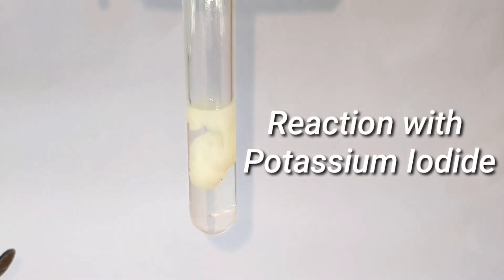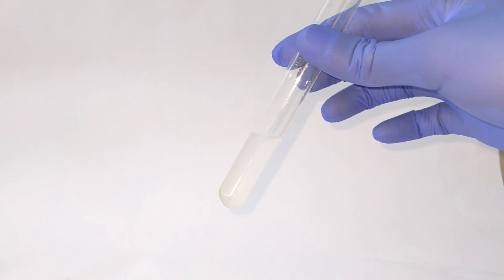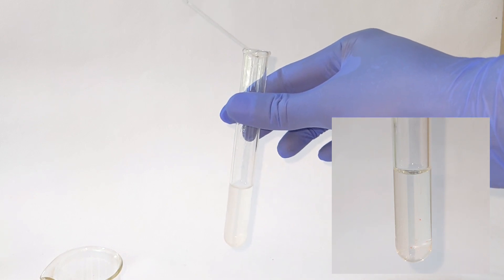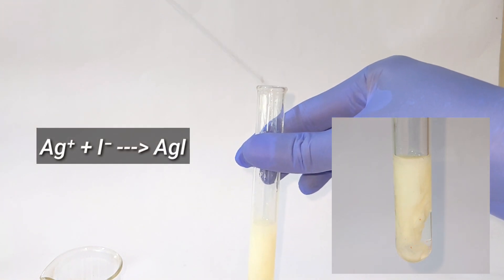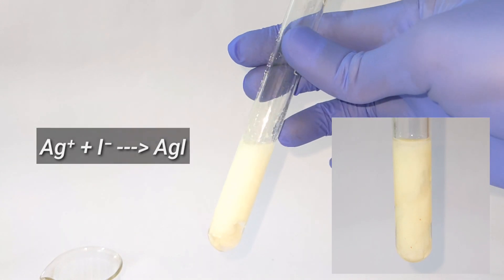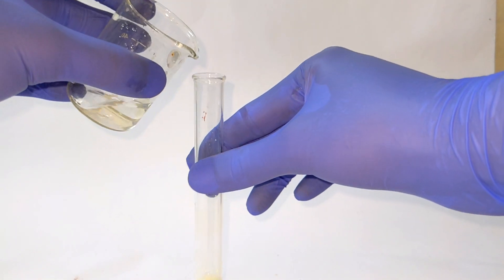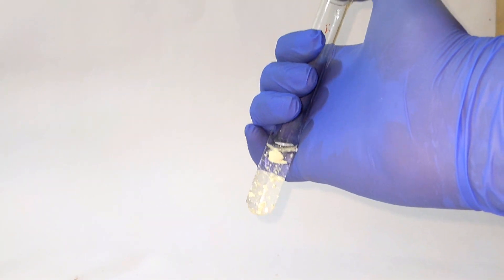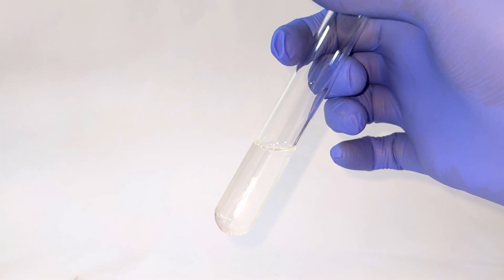The next is the reaction with potassium iodide solution. A few milliliters of the N/10 silver nitrate solution are taken in the test tube, and into that was added a few milliliters of potassium iodide solution. Immediately you see a light yellow — very faint yellow — colored precipitate forming, which is silver iodide. When a saturated solution of sodium thiosulfate is added to this precipitate, it dissolves, resulting in a clear solution due to the formation of the complex thiosulfato-argentate.